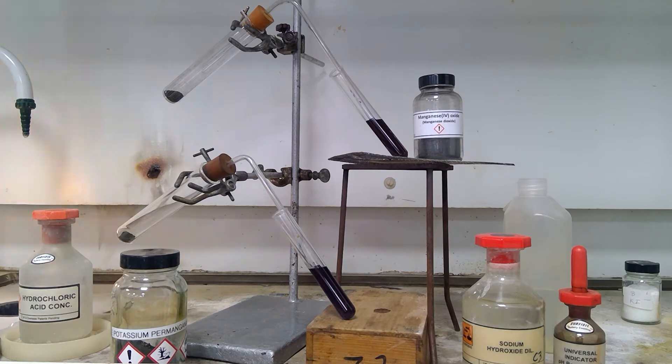Chlorine is a gas that when it dissolves into water produces acid, so it will neutralize the sodium hydroxide, but the chlorine is also bleaching. We will look at the rate at which the chlorine is produced and this effect upon the indicator in the sodium hydroxide.